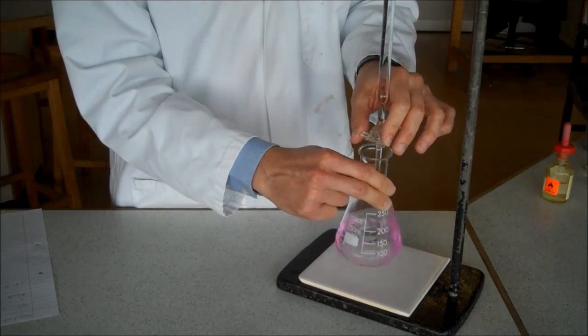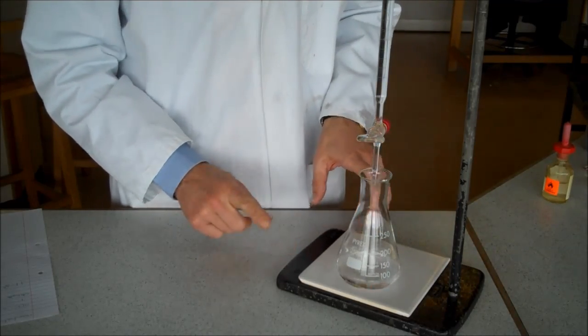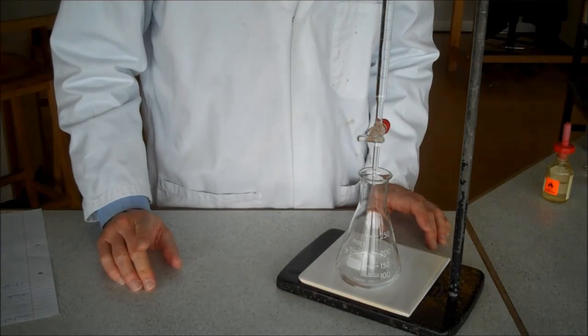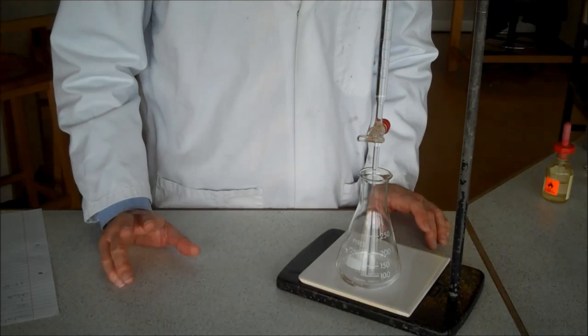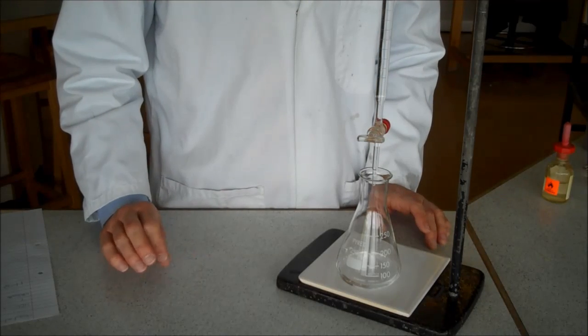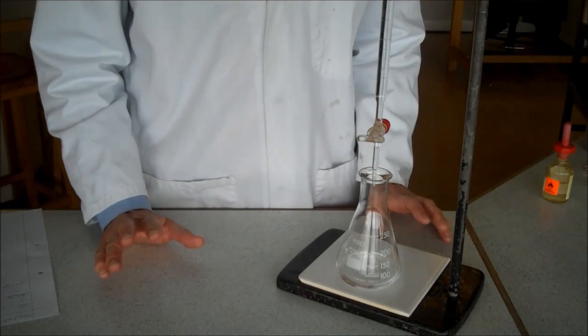I think I'm getting close there now. Yeah, it's nearly gone colourless. One more drop, and it goes colourless. Make sure you use the word colourless, not clear. The solution was clear at the start, but it was pink. The solution has gone colourless. Do not say it's gone clear, because it was already clear.